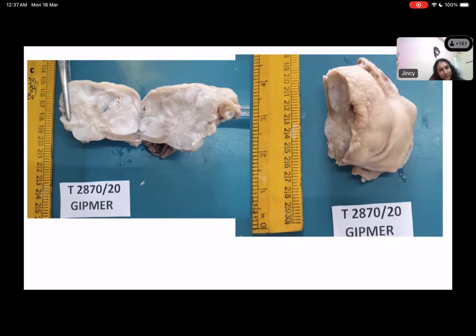So when we're describing the gross, what all do we describe? We describe whether it's covered, which of course here you're not handling the specimen, so you may not be able to make out that it's covered by mucosa, which is flattened. What is this, where the pen is? This is the muscle layer. Okay. And then you described a lobular tumor, well circumscribed.